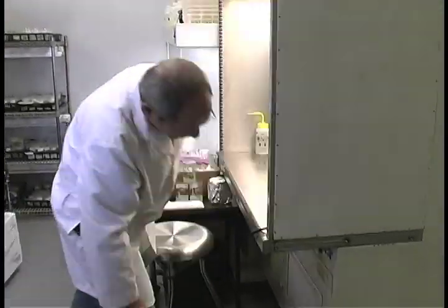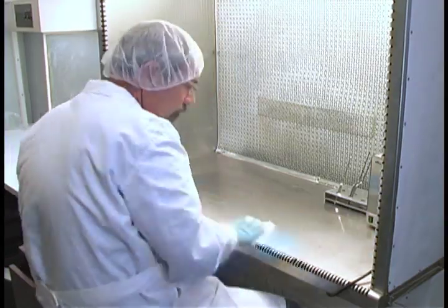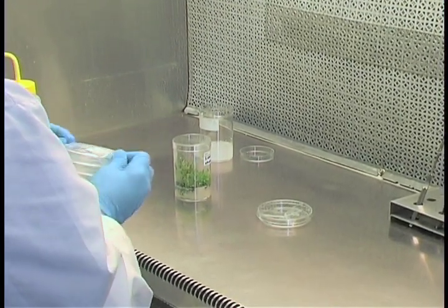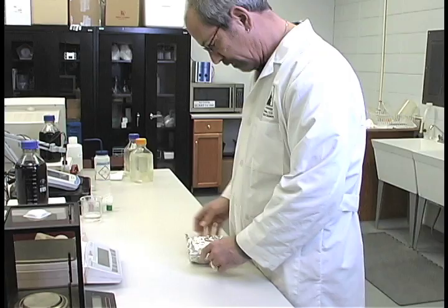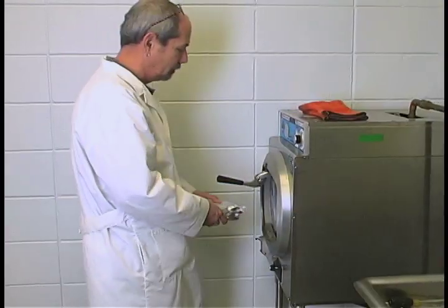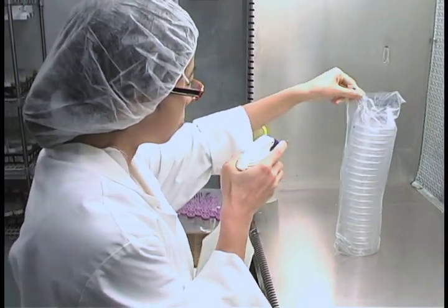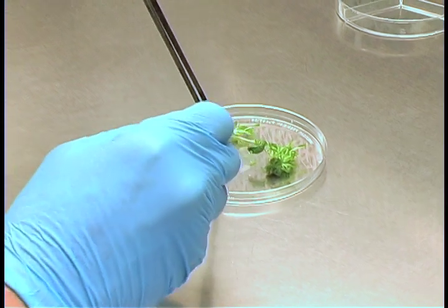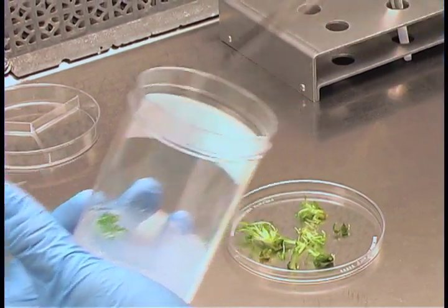Turn on your hood and spray or wipe down the hood and transfer areas with 70% alcohol approximately 30 minutes before starting to make transfers. A sterile work surface is needed on which to place the sterile tissue to trim it. A sterile petri dish is a convenient surface upon which to work. Glass petri dishes can be autoclaved and reused. Pre-sterilized plastic dishes are used and discarded — spray the bag of dishes with 70% alcohol before you open it and place the desired number of unopened dishes at each station. Each dish has two sterile surfaces: the inside top and inside bottom. When transferring plant parts from one container to another, do not touch the inside edges of either vessel.